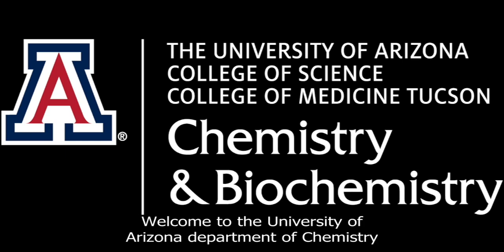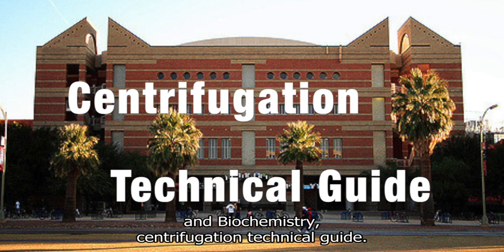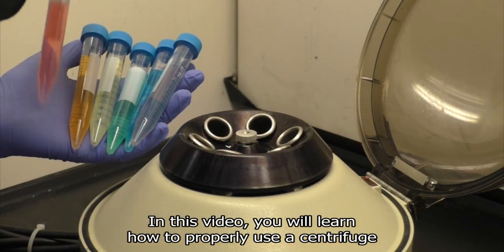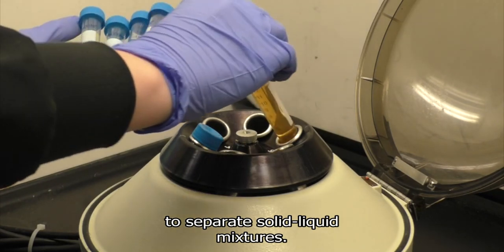Welcome to the University of Arizona Department of Chemistry and Biochemistry Centrifugation Technical Guide. In this video, you will learn how to properly use a centrifuge to separate solid-liquid mixtures.